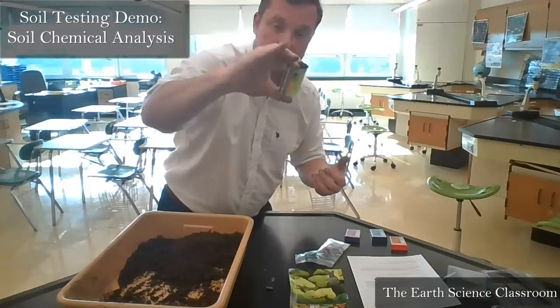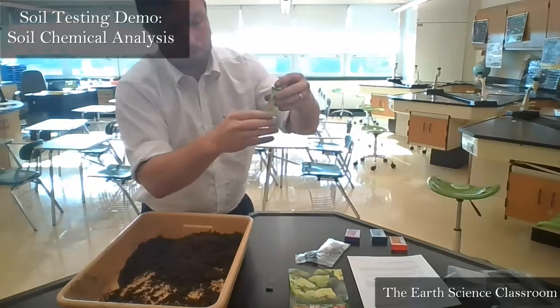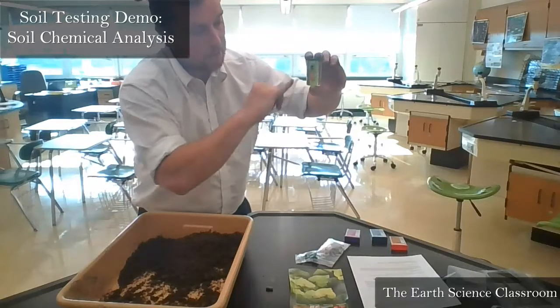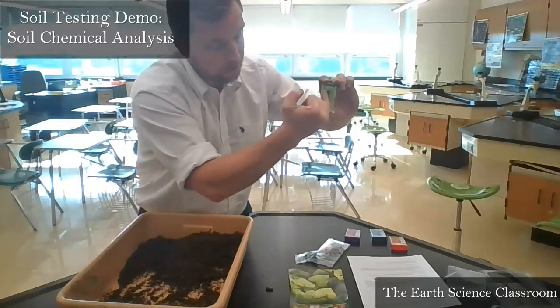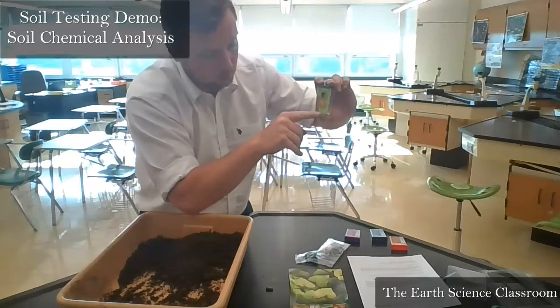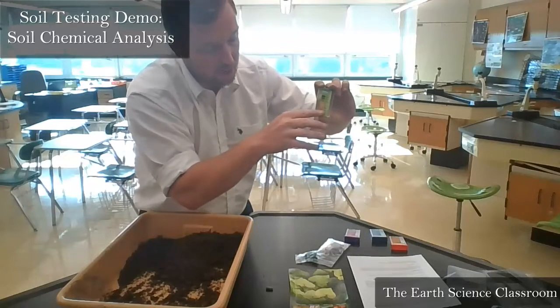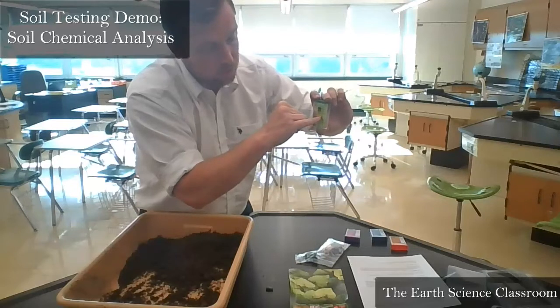What's going to happen is the chemical indicator, once we let it go, okay, we stop shaking it, it will start to settle. And we have this scale over here. It's a pH scale. It gives you these colors, and that represents the amount of acidity or alkali in the soil. Now, the lowest one, the red one right here, is very acidic, pH 4.5, and it goes up. So the number increases.